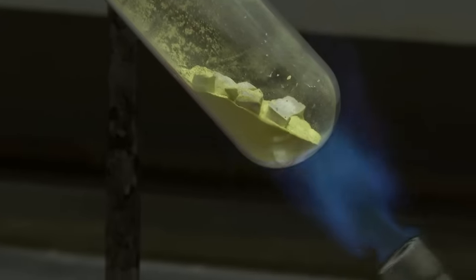But I really wanted to see the tungsten reacting with bromine. Bromine, as you know, is this red gas. It's in the periodic table below chlorine. It comes from the Greek word meaning a stench, terrible smell. So you have to do it in a fume cupboard. So we tried heating the tungsten wire in bromine. And I was quite pleased with the result.